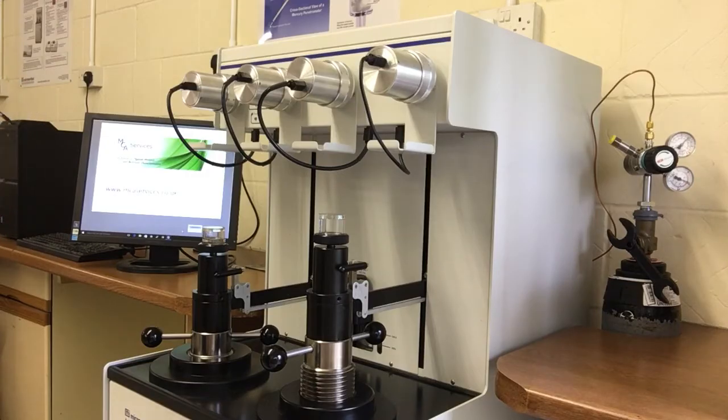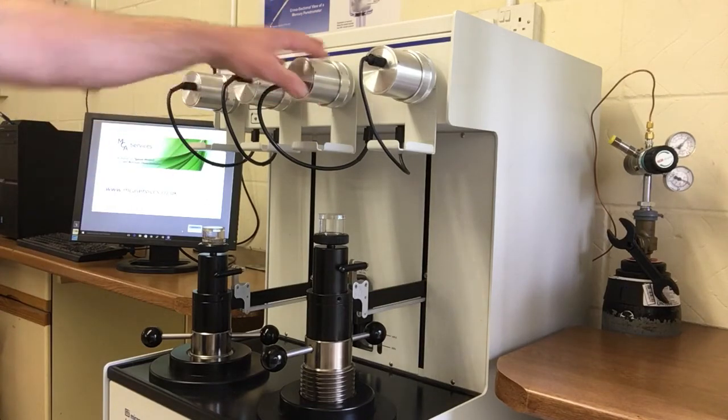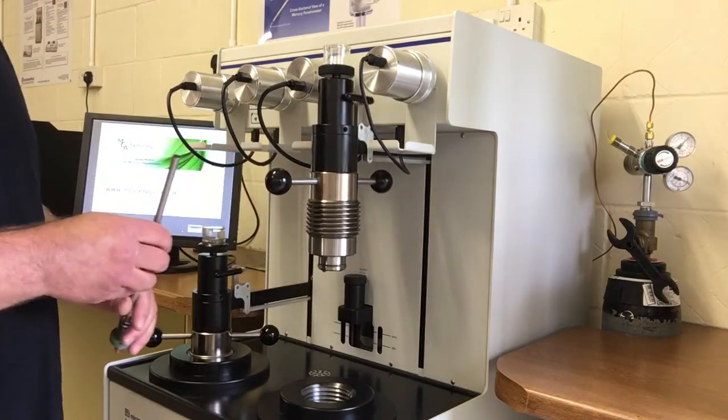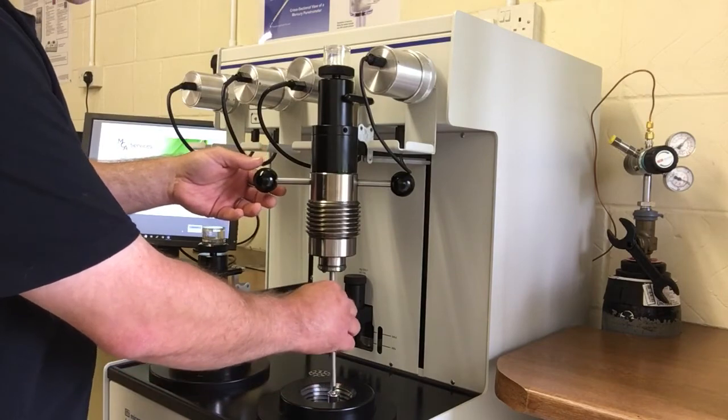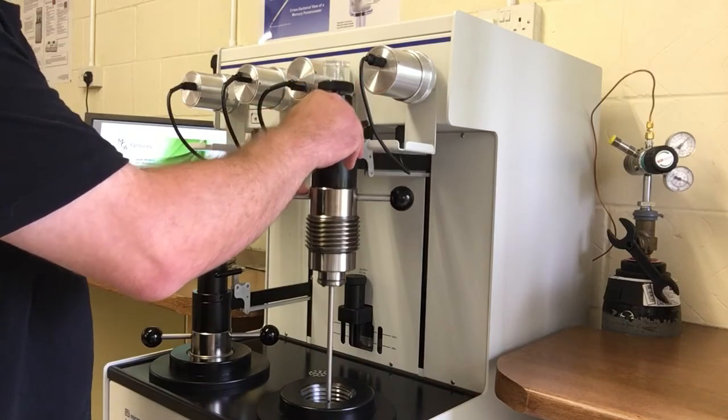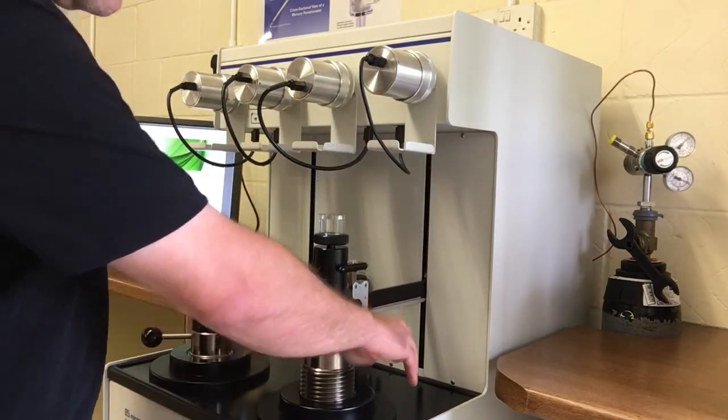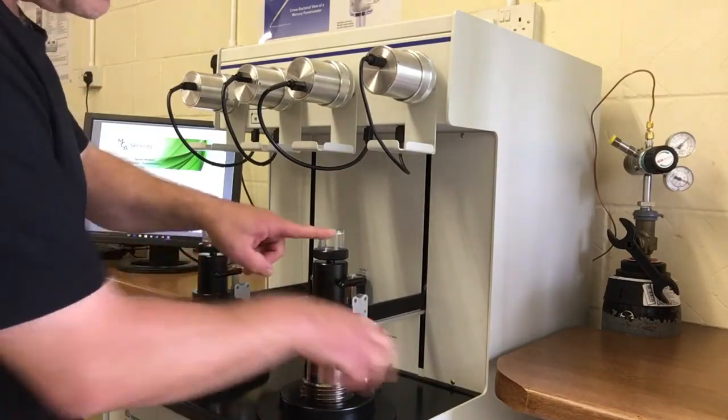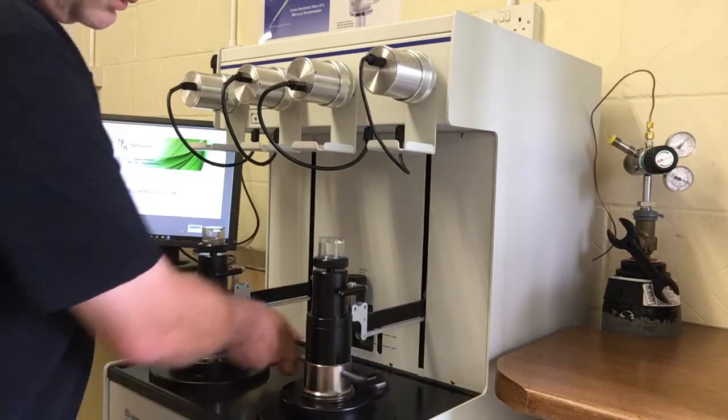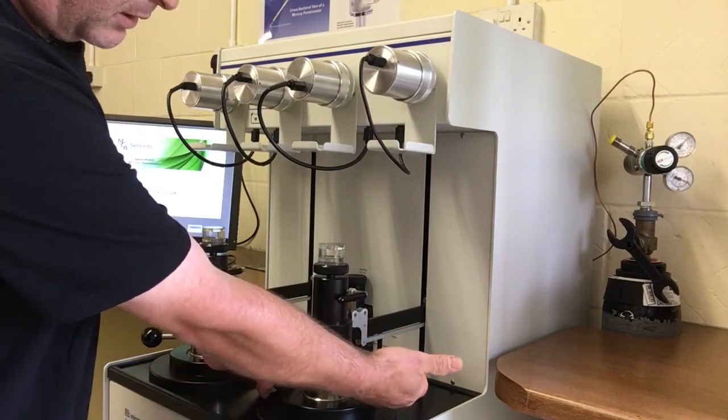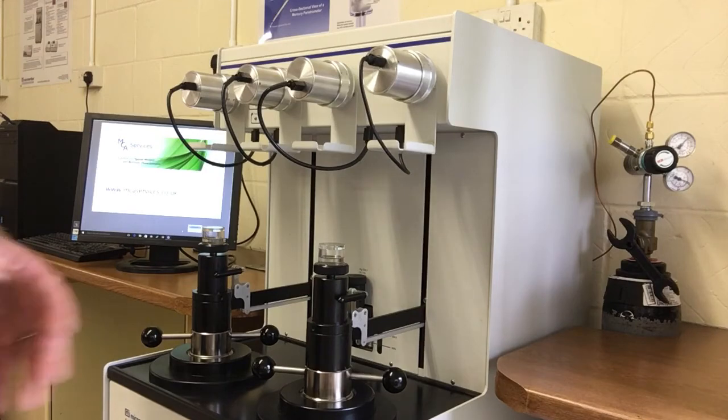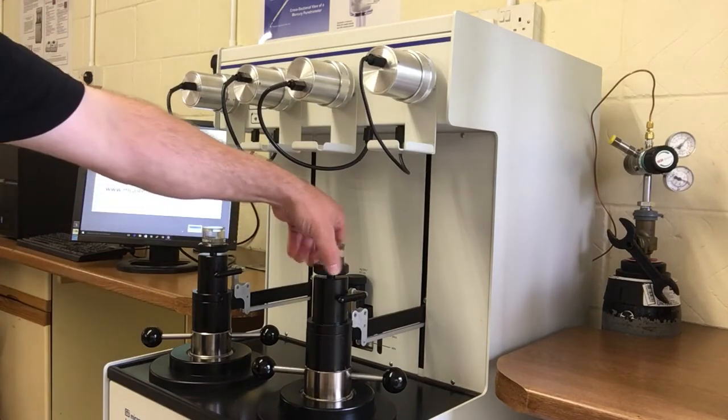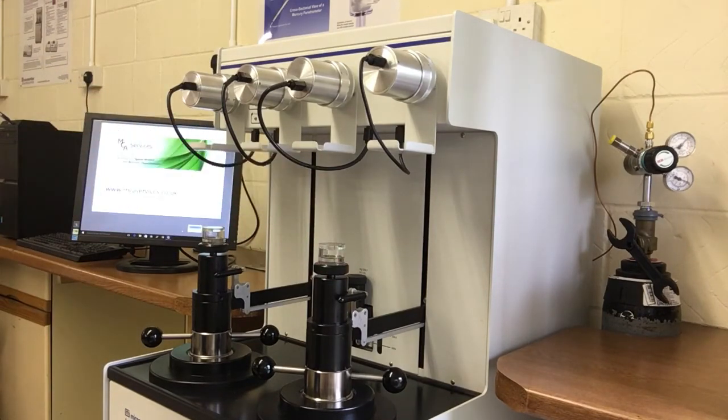I've now weighed the penetrometer. I've also replaced the blanking rod and reassembled the low pressure port we were using. And we'll use the high pressure port on this side. The penetrometer now sits vertically in this port. And in the port we have the hydraulic fluid that's used for increasing pressure. We'll wind this down and we'll see excess high pressure fluid coming up into this sight glass here. Now we'll leave that just for a minute or two to make sure there's no air bubbles in there. Once we've done that we will be ready to just close this valve off here and start the high pressure analysis.